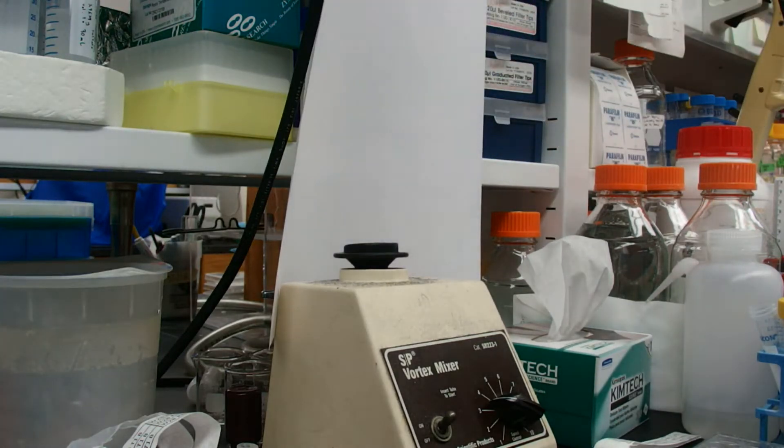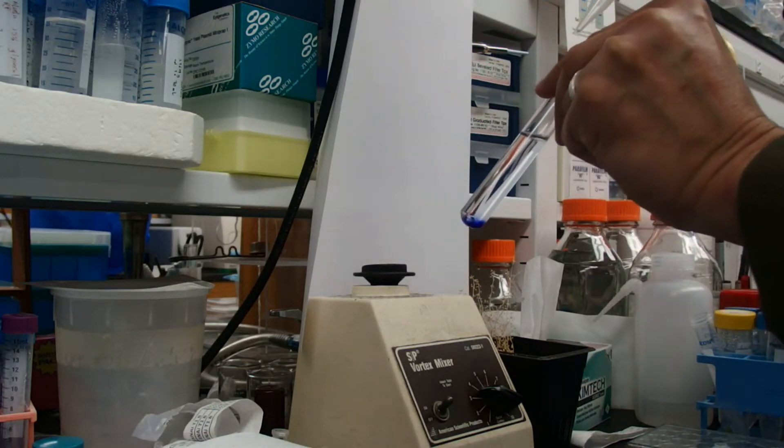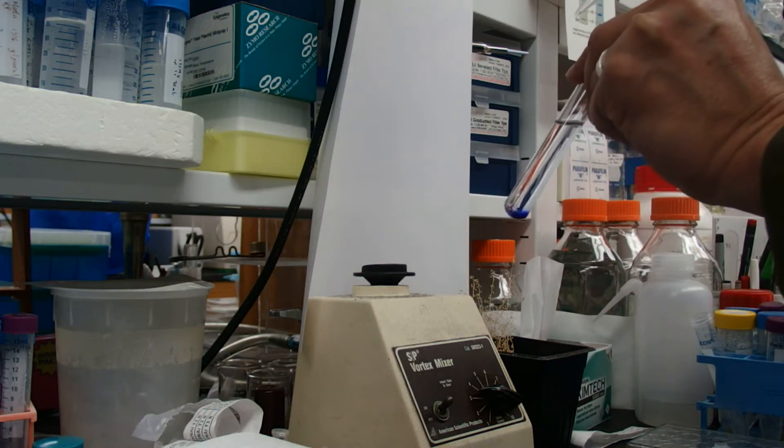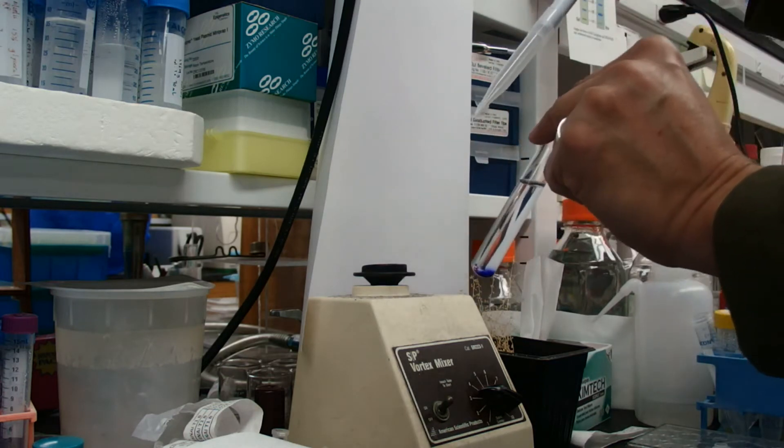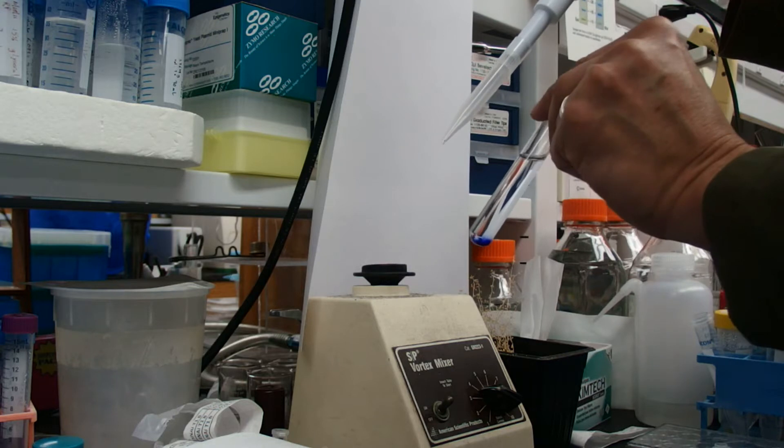That's a well-mixed solution. Another way we can mix is by pipetting. The important thing to consider here is you have to be at least moderately skilled with a pipetter so as not to suck up any liquid into the pipetting shaft. That could ruin your pipetter depending on what liquid you suck up.